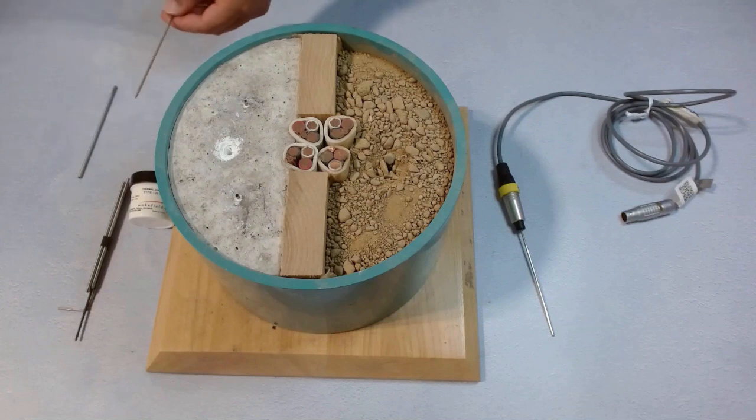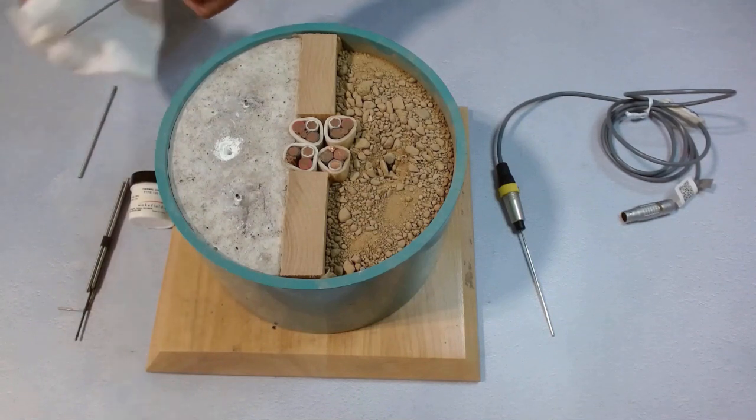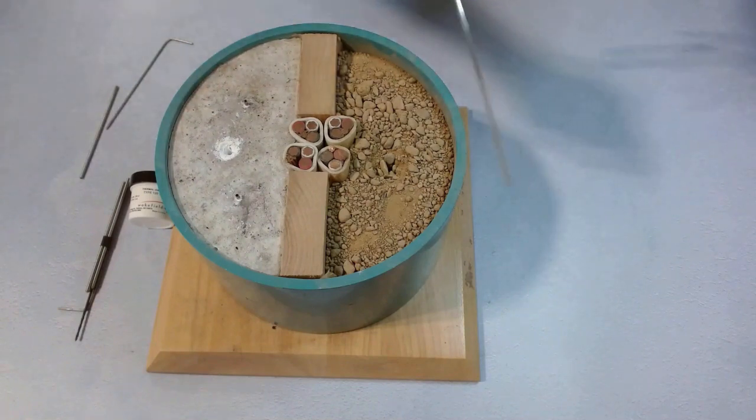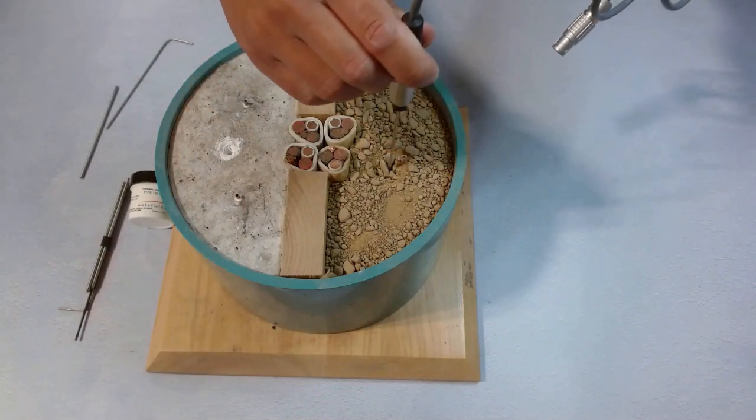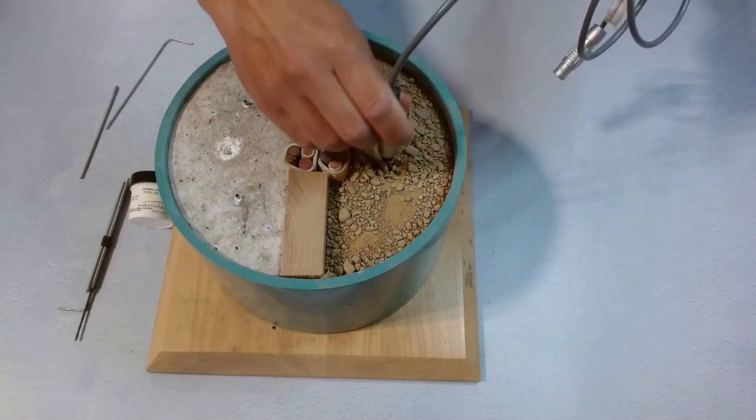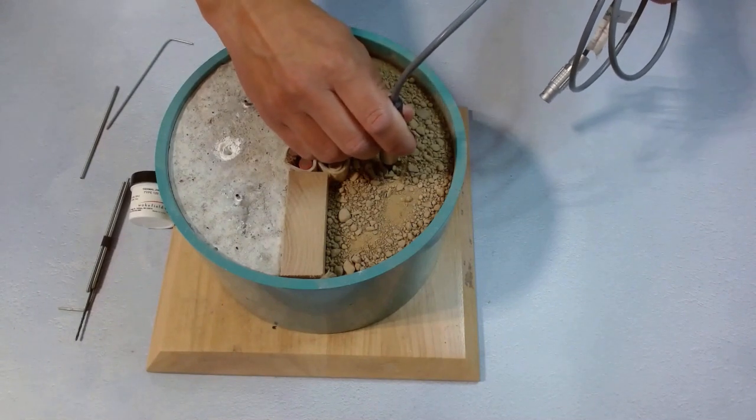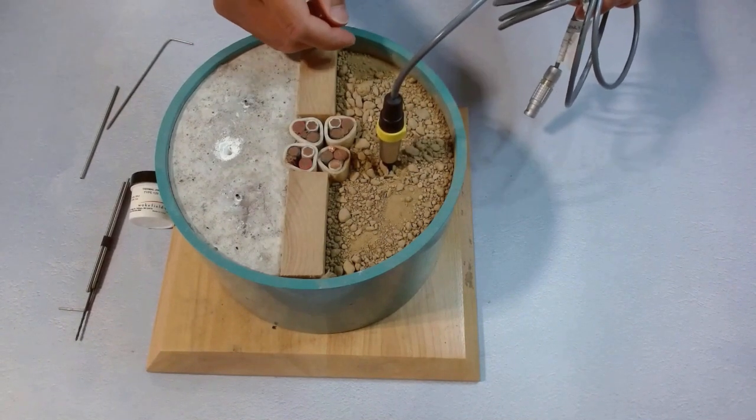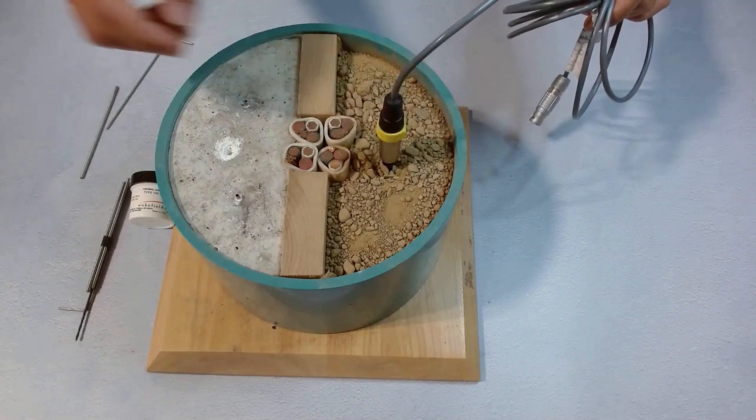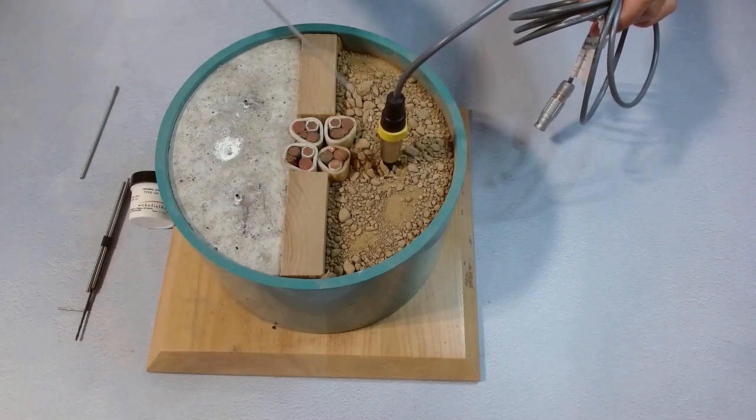Okay, now we have the hole. We wipe it clean a little bit. Now we take the TLS100 needle and try this hole. Gently. It goes in without problem this time, but not always.